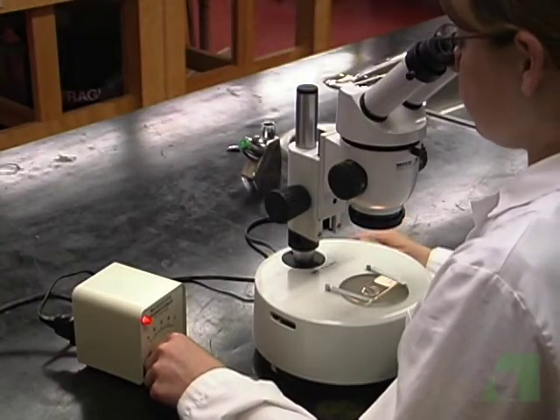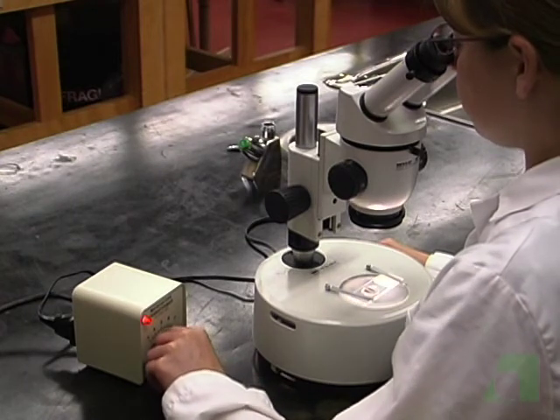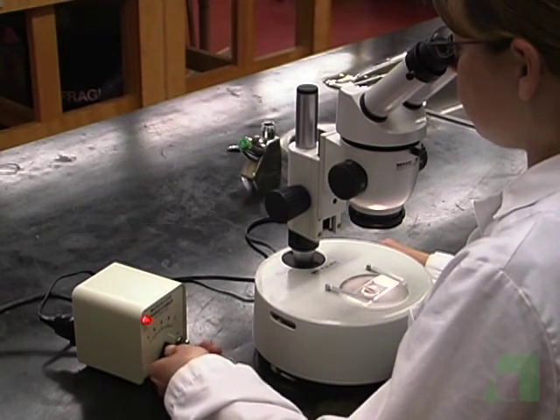If an object is transparent or can be made translucent by cutting it into thin sections, light can be passed through the specimen. This is called transmitted light. Transmitted light is supplied from below the object.